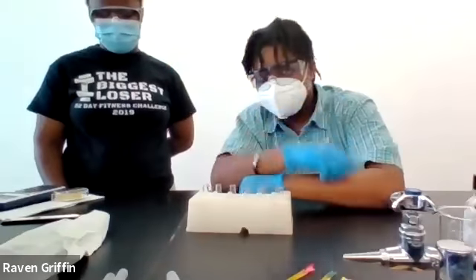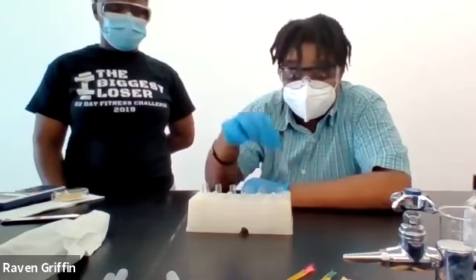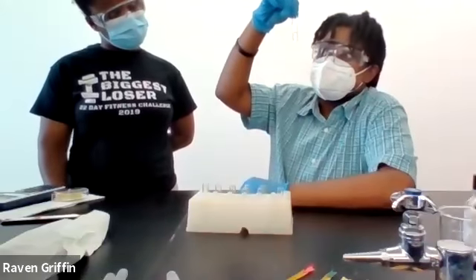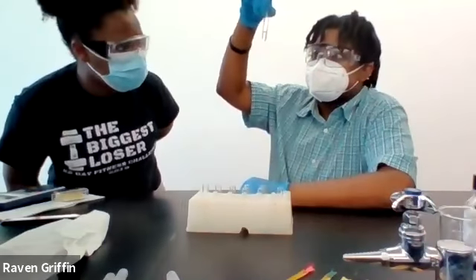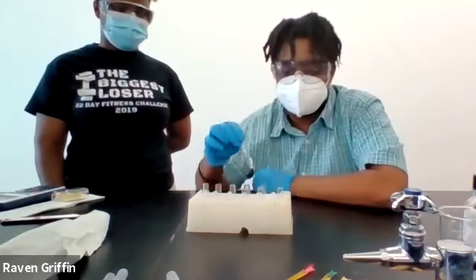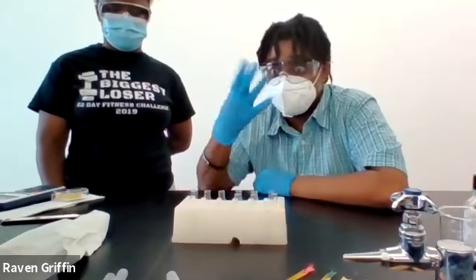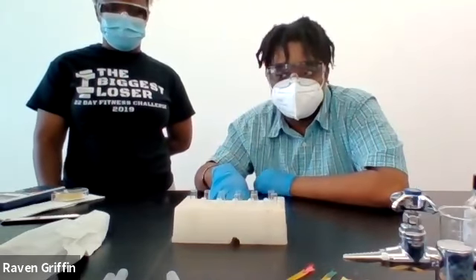And you just write your observations under each one, which would be really nothing, because I don't see anything in here. It would seem these concentrations of acid are too low for a big noticeable reaction to take place.